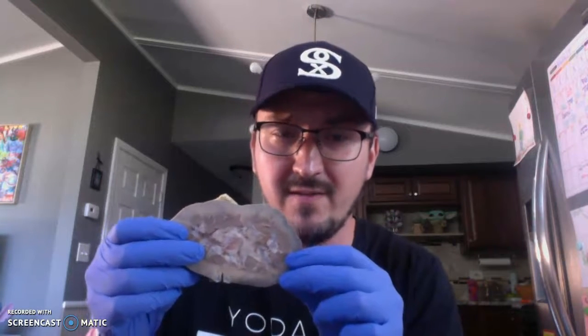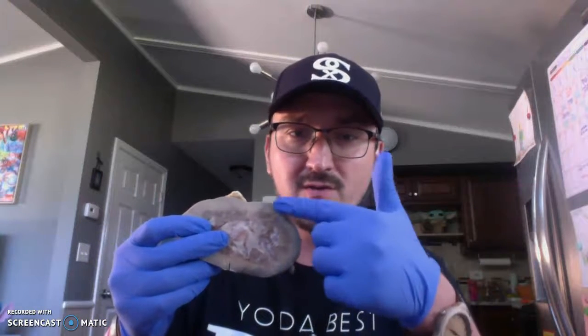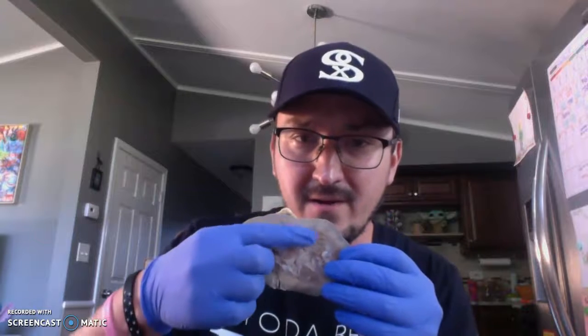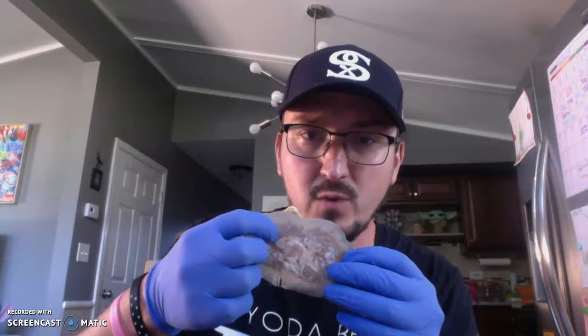So let's get started. I sliced this kidney in half, so we have a longitudinal section of the kidney here. Here's the exterior part. First we'll talk about the cortex — that's the outer section here. And then the inner darker section here is the medulla.